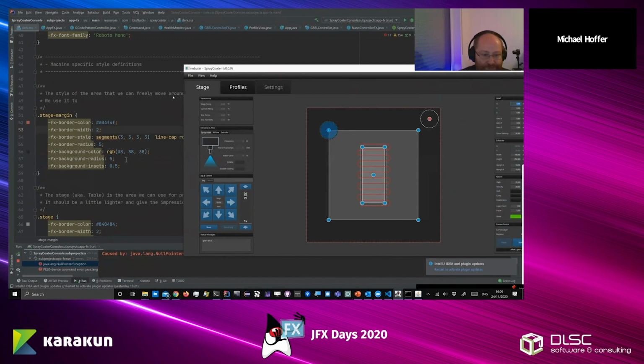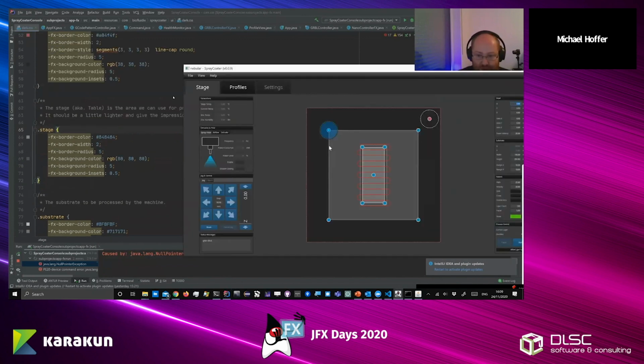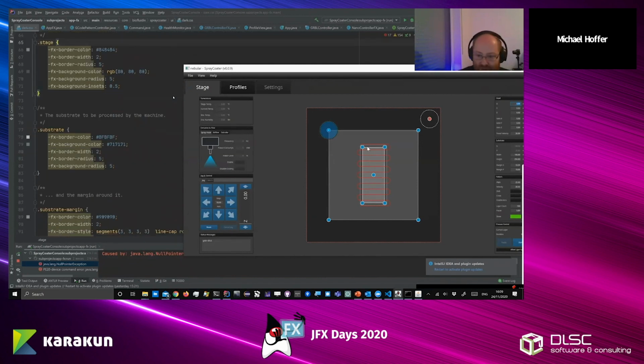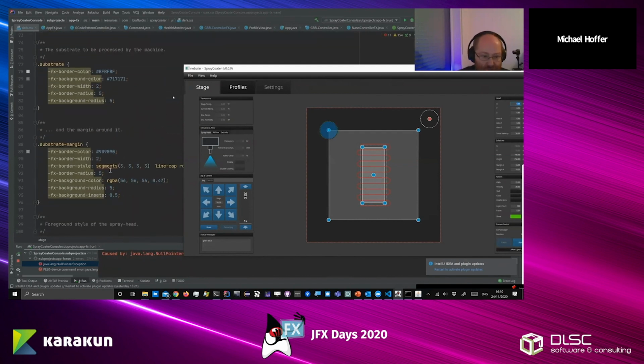And here is the same for the stage. So this is this inner gray rectangle. It also has just a border color, background color, really basic stuff. And the substrate, which is this rectangle here, also has just the basic definitions of border and background.